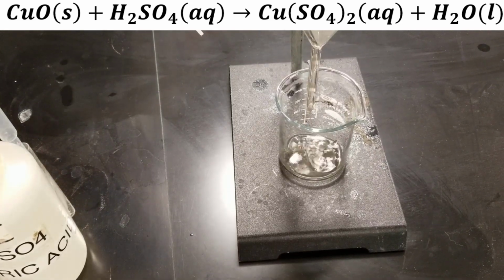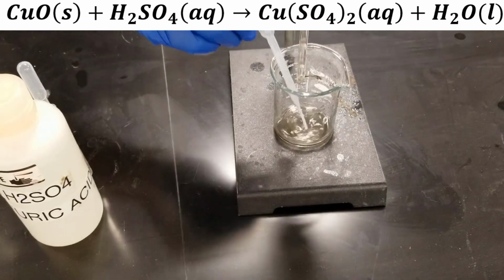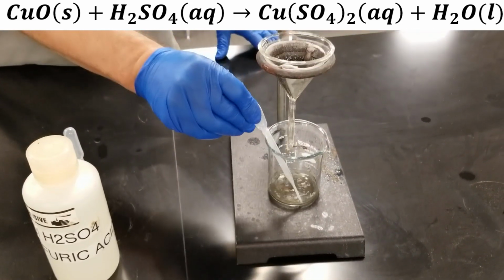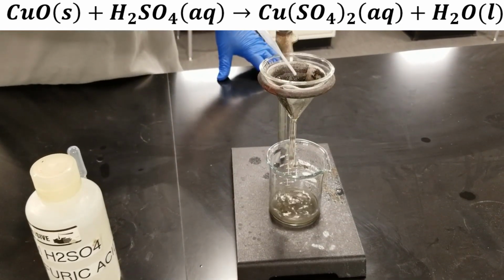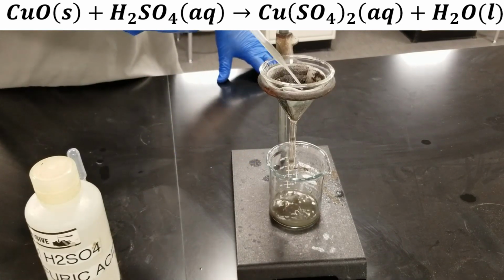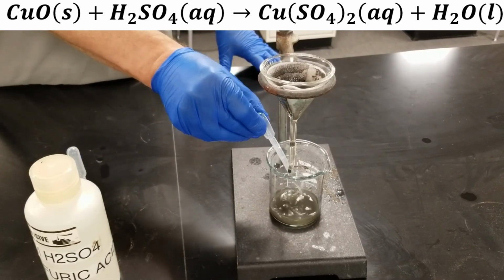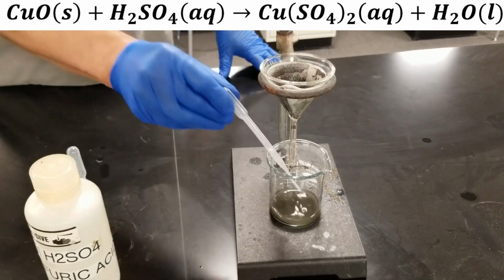So what we're going to do, as it comes through, we'll take some of it and put it back in the top. If I keep doing this, in a few minutes, all that black muck of the copper oxide will be dissolved, and we should have a nice blue solution of copper sulfate in our beaker.